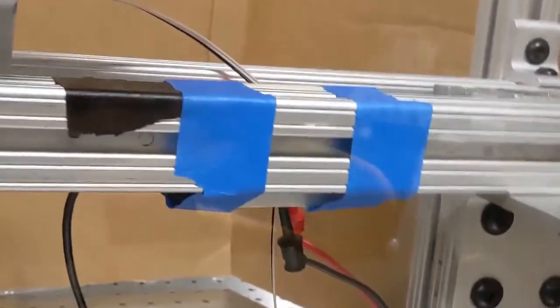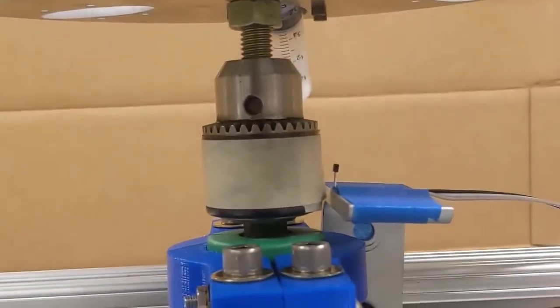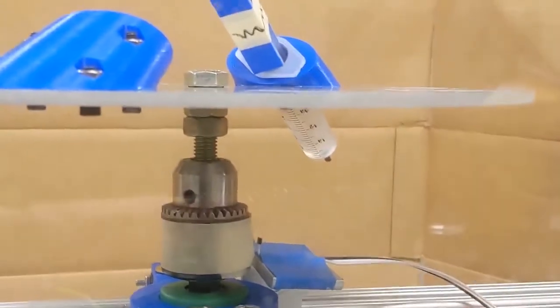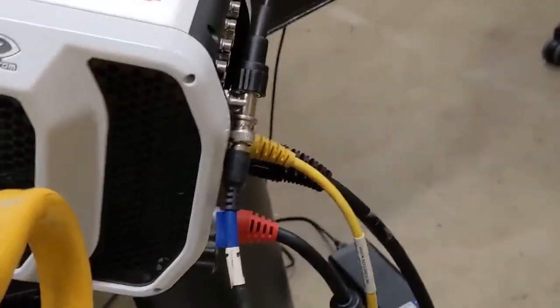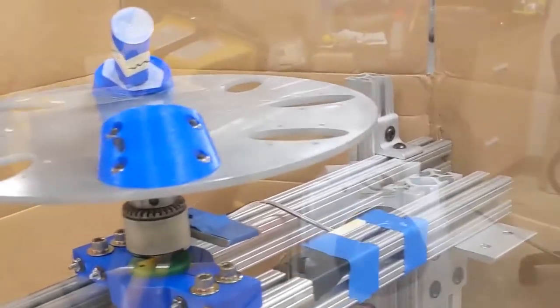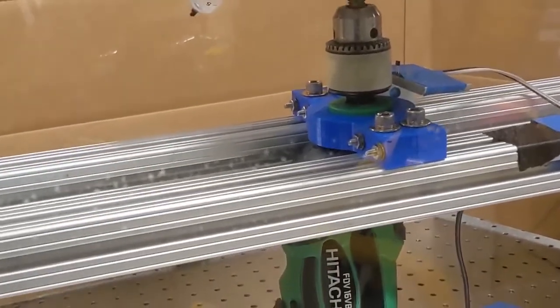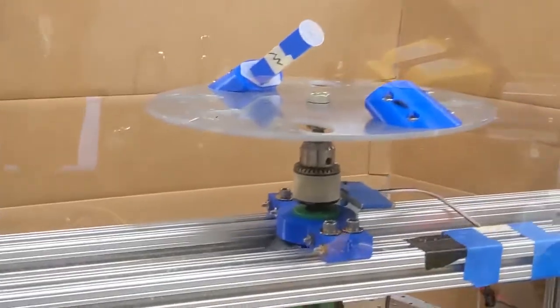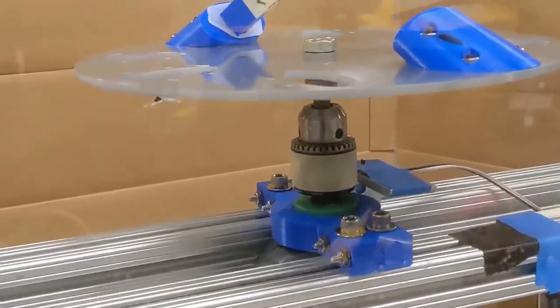The interesting part about the setup is that we have an Arduino connected to a Hall effect sensor, and the Hall effect sensor senses the position of a magnet that is attached to the hand drill. When the Hall effect sensor sees the magnet, it sends a signal to the Arduino. The Arduino reads that signal, parses it, and sends the trigger to the camera. There's a frame sync here, and then we can take a picture every rotation at roughly the same angle, and that allows us to make the movie that you saw, which lets us see the progression of the centrifuge for every cycle. That's a very simple setup. I think it's simple to build something like this at home, perhaps a little bit better, and it's very effective at removing the bubbles.